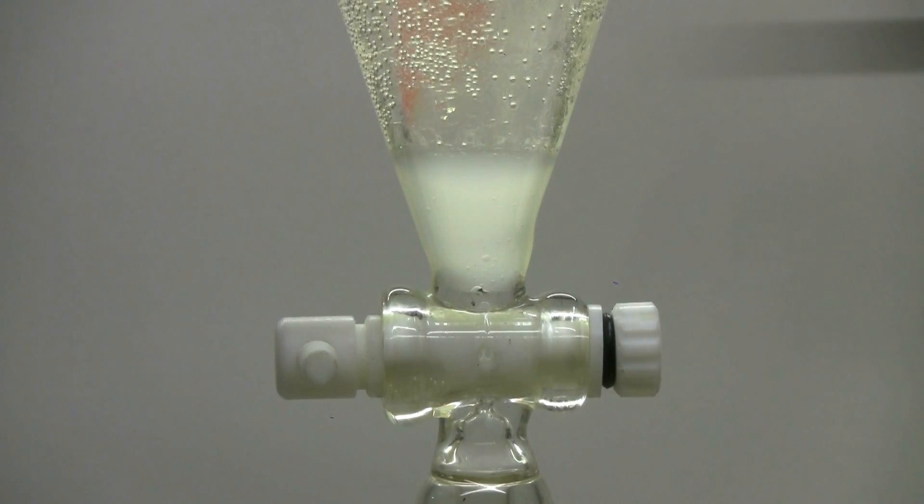My yield here from this reaction will be about five milliliters of chloroform.